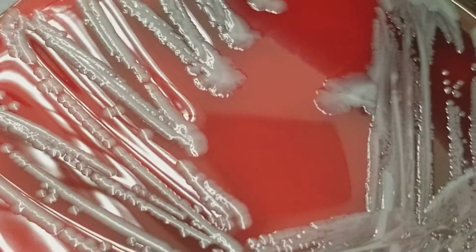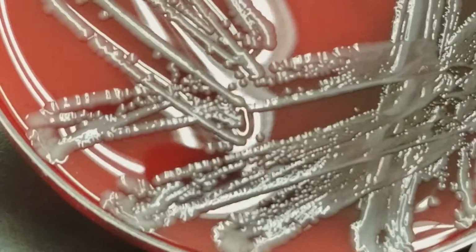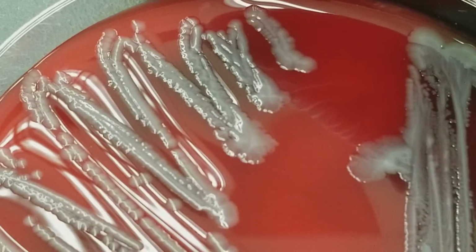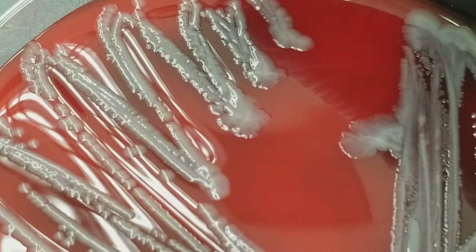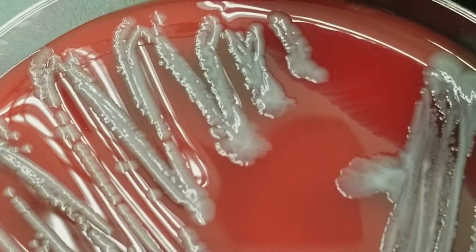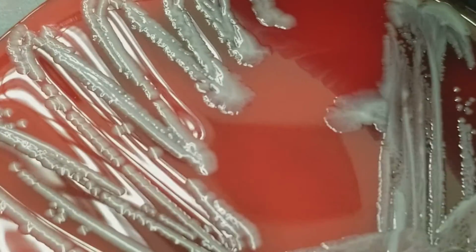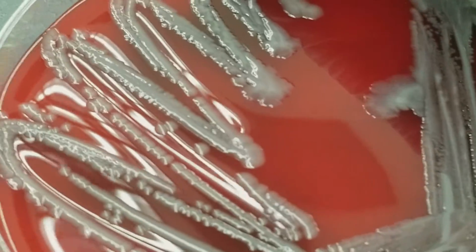Okay, here is another one. This is from a sputum. Okay, ooh, this is so much different than what we've seen before. These colonies are a lot bigger. They spread out, but that's not swarming, okay? Please understand that's not swarming. They definitely spread out more, okay? And this is actually a gram-negative rod. This is going to be Klebsiella pneumoniae. I think that's what we have, yeah. Klebsiella pneumoniae, and this is actually antibiotic resistant Klebsiella pneumoniae.